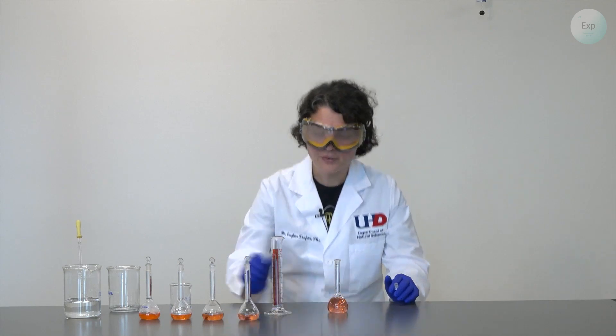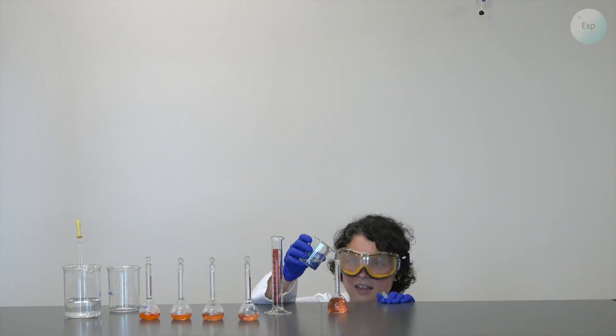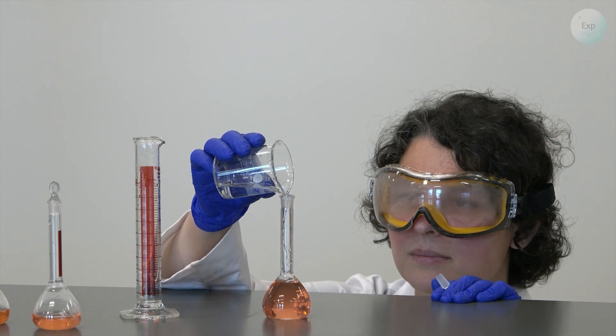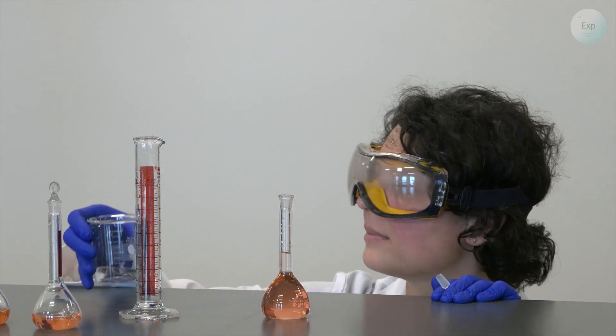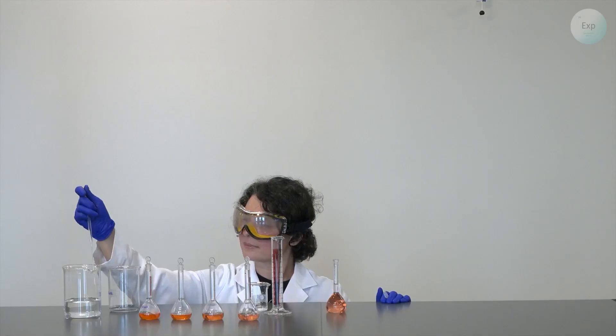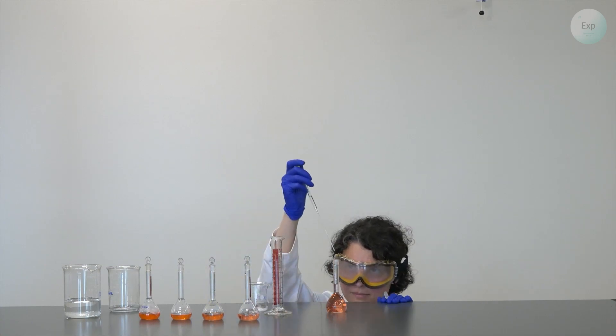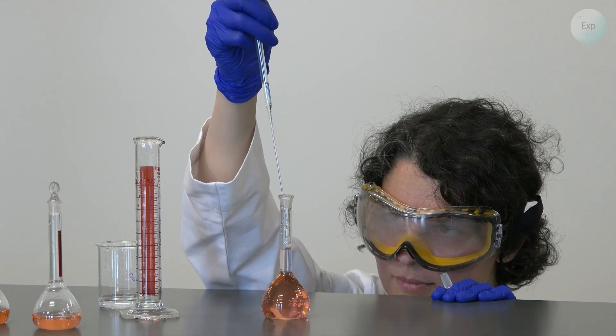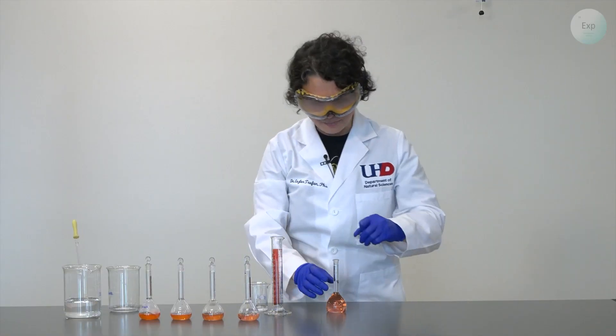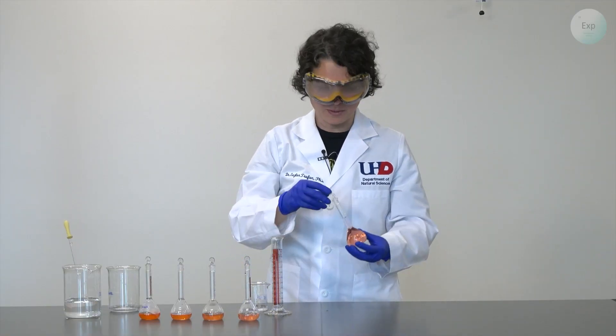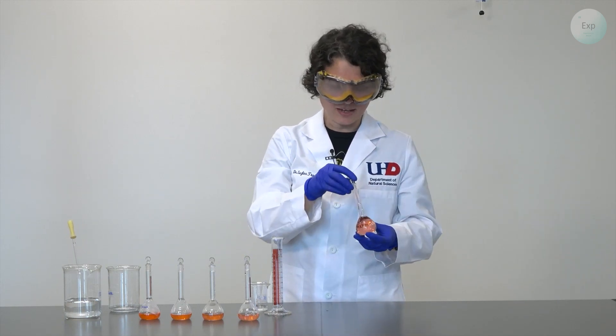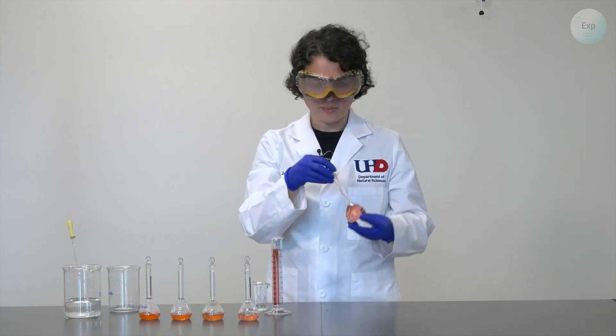I am still reasonably far from the mark. And my hand is relatively steady, so I can add a little bit more water. And now that I am very close to the mark, I need to switch to the pipette. The meniscus of my solution is at exactly 50.0 milliliters. And I will perform the last homogenization.